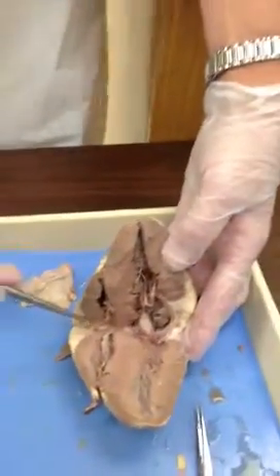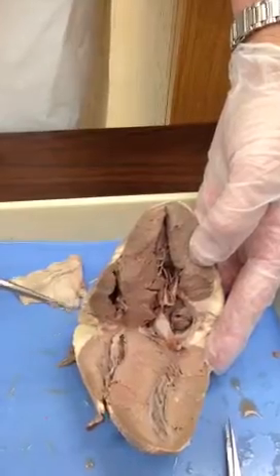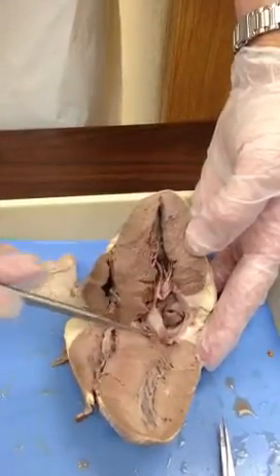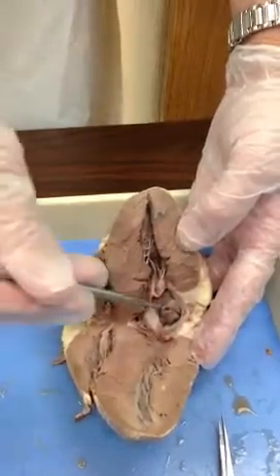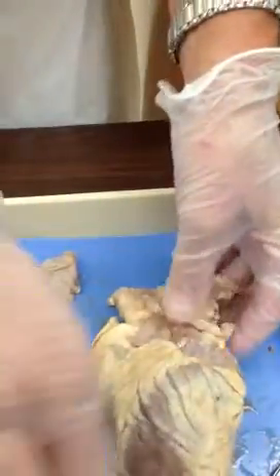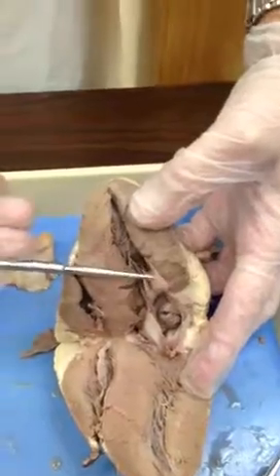So we've got on the list valves. We've got two categories of valves. Notice it says atrioventricular valve, and that's one of these. And the other name are the semilunar valves. Atrioventricular valve tells you it's between an atrium and a ventricle. Here's an atrium, here's a ventricle. So let's open it. Here's the valve. It has cusps. So this particular valve has been broken, right?